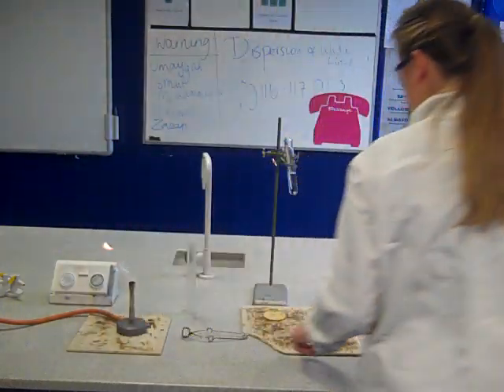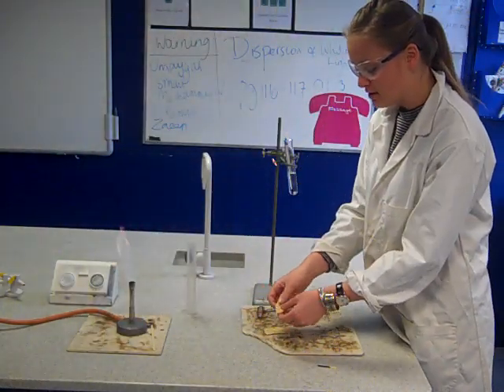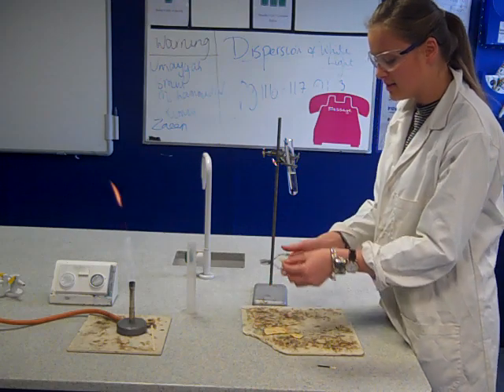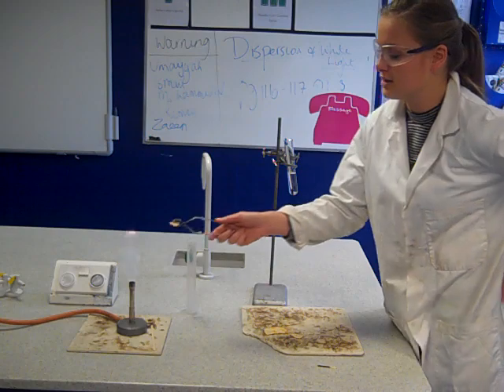Okay then, so using your tongs, you need to hold that piece of your food nice and safe. I wouldn't suggest having a really large piece. Just make it small enough so we can hold it underneath.